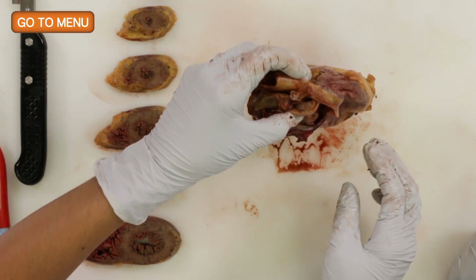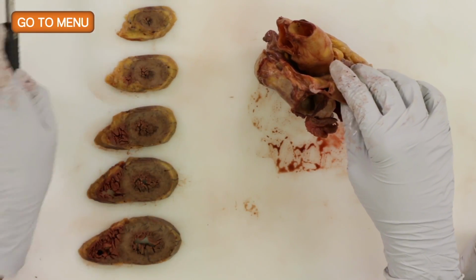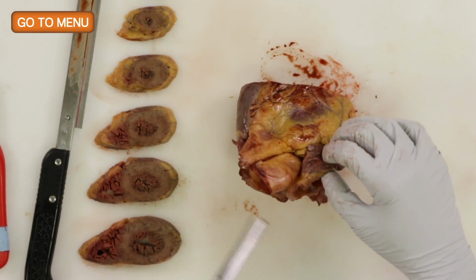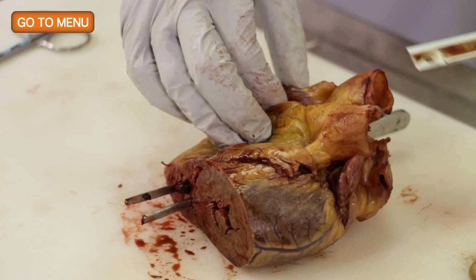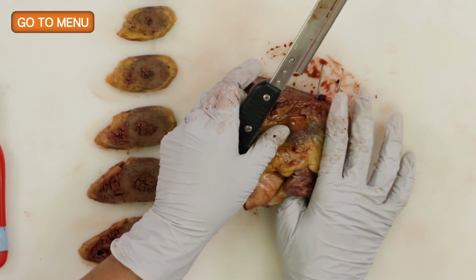So you can make that cut. Sometimes I just like to use the probe. Yep. Make sure you have a surface to cut on. And you're going to go out laterally, yeah.